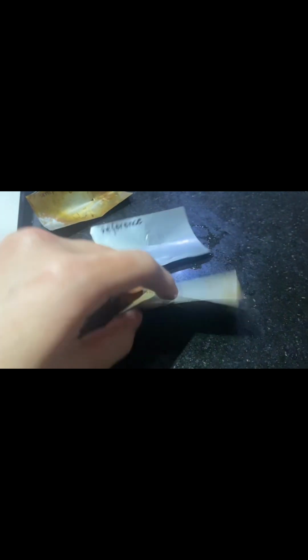In contrast to the reference, in the tempering, if you try to make a hole in the aluminum, as I commented before, because it was heated and then immediately cooled in water, you'll find a different scenario than the annealing. First things first, the rapid cooling process, known as quenching, effectively locks in the structure of the aluminum at the elevated temperature. This can lead to a state of increased hardness and reduced malleability compared to the heated-only sample. We can see here it's harder and less malleable than the reference.